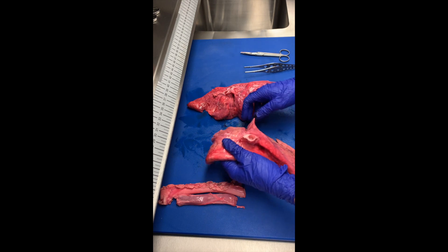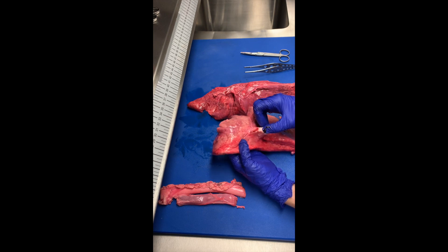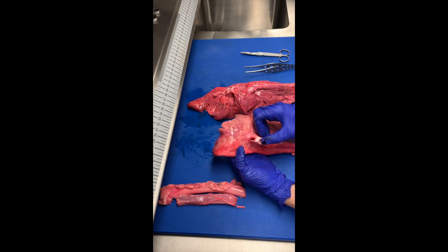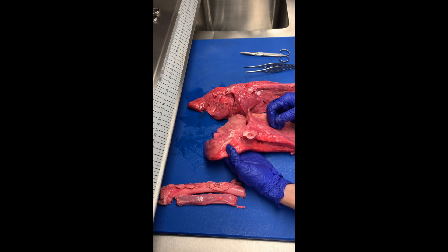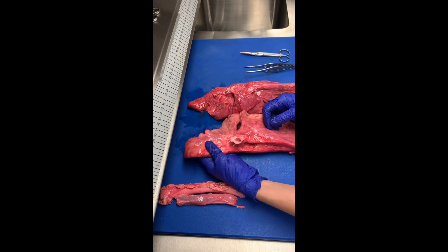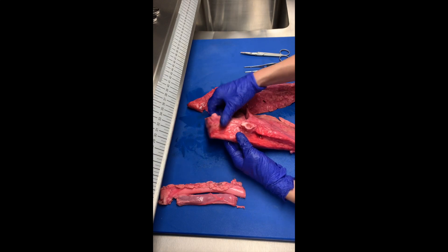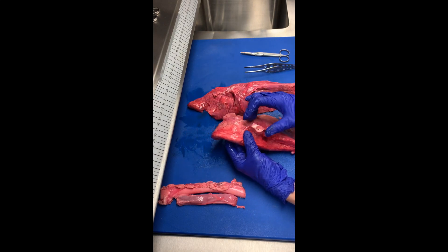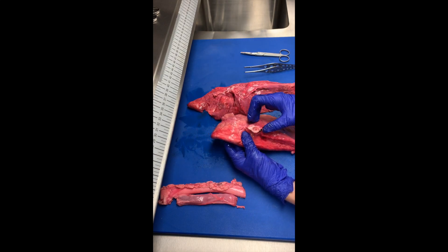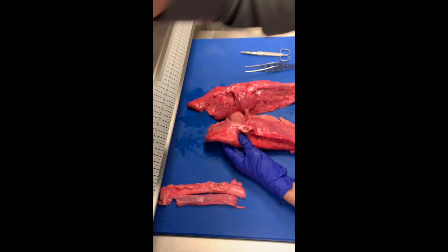As we talked about in lecture, when looking at the lung you have another way of orienting yourself to which lung you are looking at, and that can be through the vasculature.